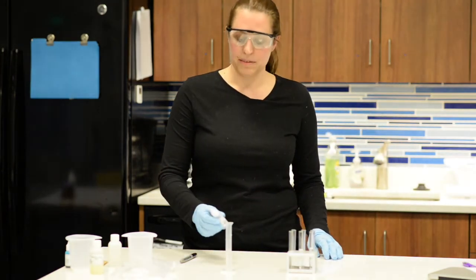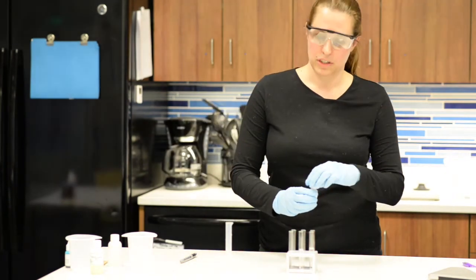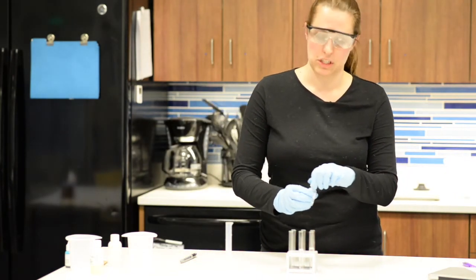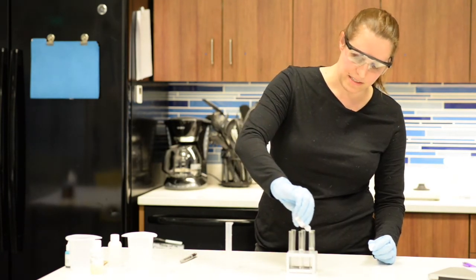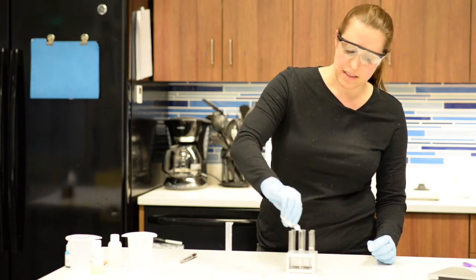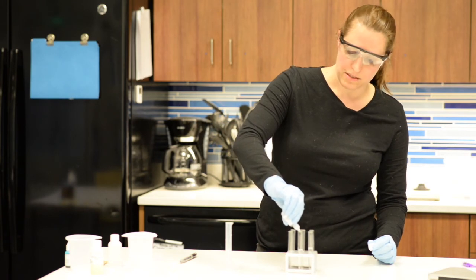Next we'll add the reagent to see if a color change occurs. If a color change does occur, we know the solution contains protein. If it does not, then we know there's no protein in the solution.